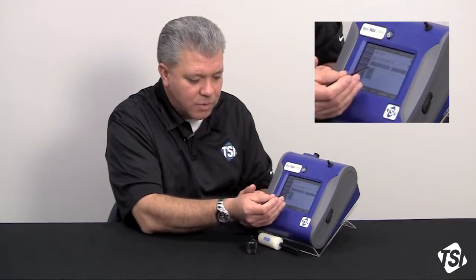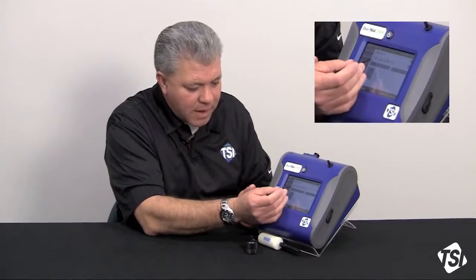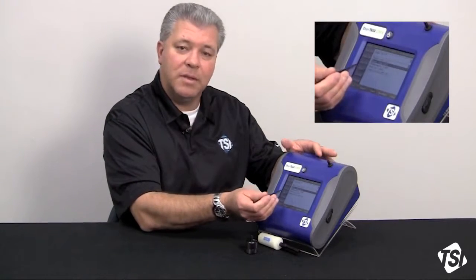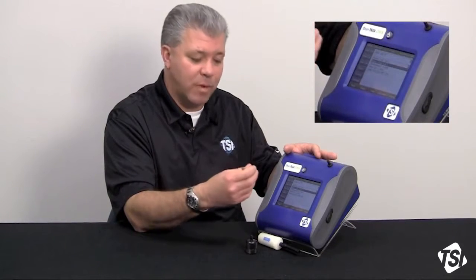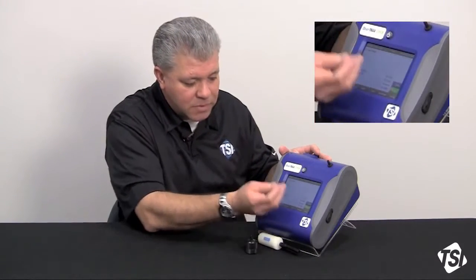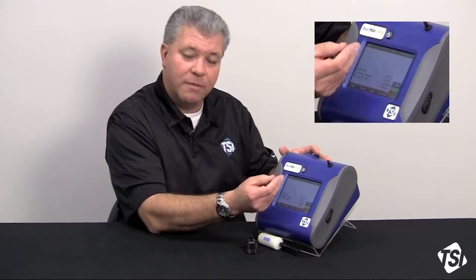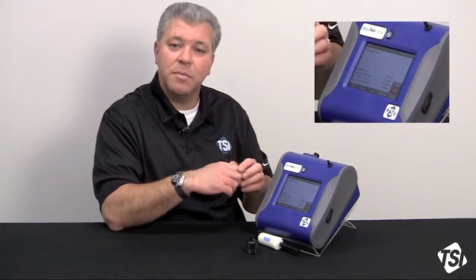Save that new number and then go and enable that user cal. On this bottom row here it'll say user cal off, and what you want to do is toggle it so that it is on, then save that. Now this user calibration with the new real-time size correction factor you just performed is input into the instrument. This is going to be the new correction factor — 1.4 for example for size correction factor — and your photometric correction factor is still 1.0. That is what the instrument is now going to run at. All we have to do is go back to the main screen; it's going to update the memory, inputting that the size correction factor is 1.4 and the photometric correction factor is still 1.0. Now when you press the start button, the instrument's response has changed to the size distribution of the aerosol in the environment you're monitoring.